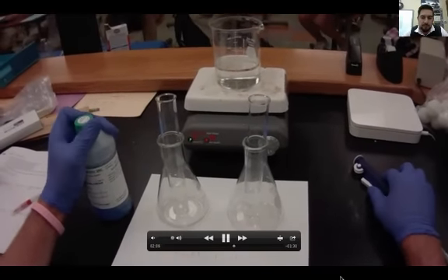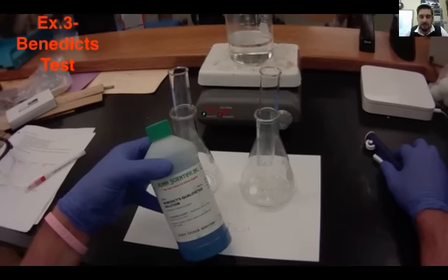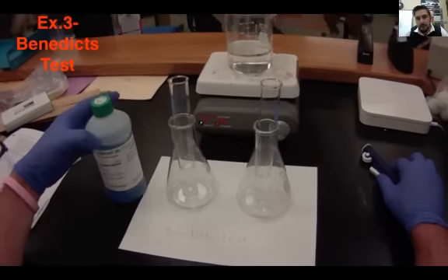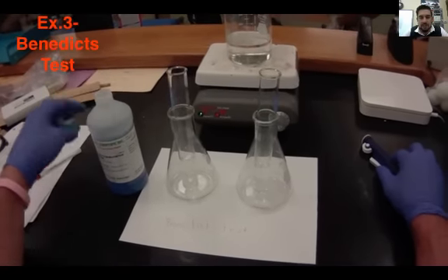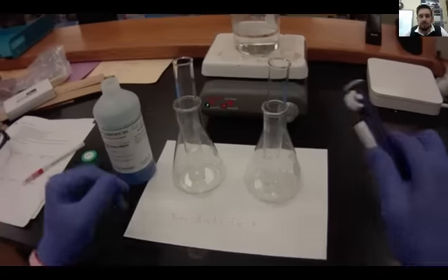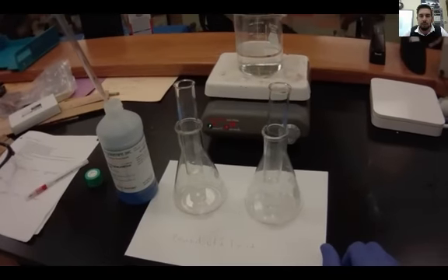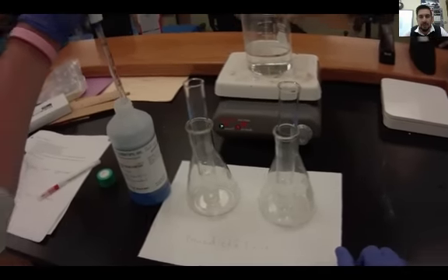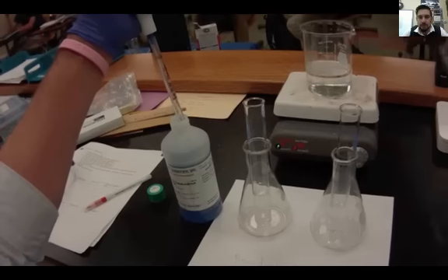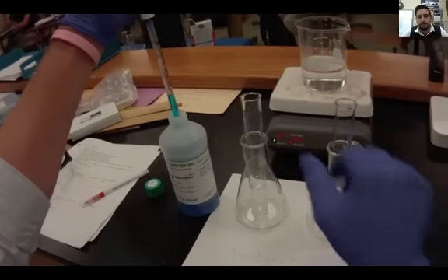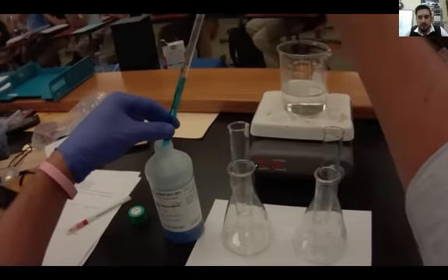This is the Benedict's test. This one requires a little heat, so I gotta use a hot plate here. I'm going to use this solution and this tests for monosaccharides, so just simple sugars. A positive test will indicate that simple sugars are present. So here I go.